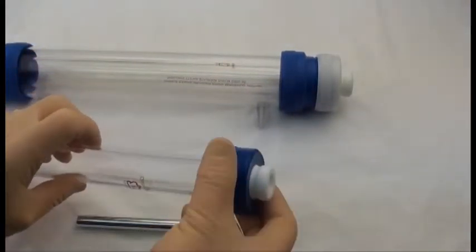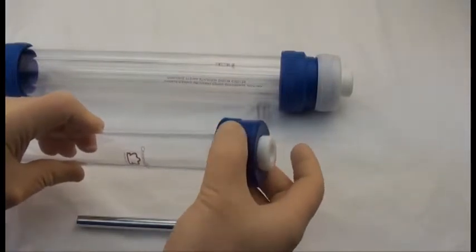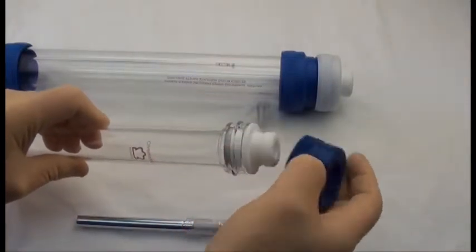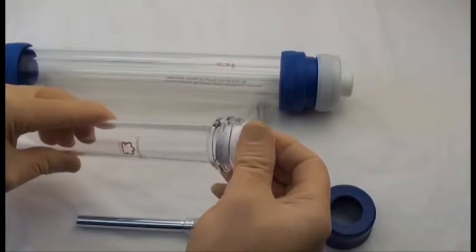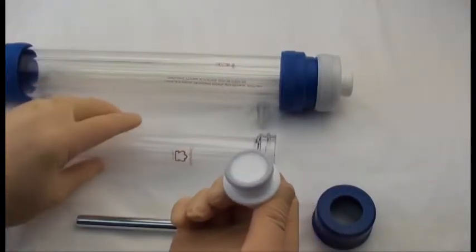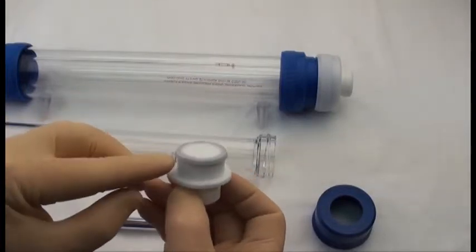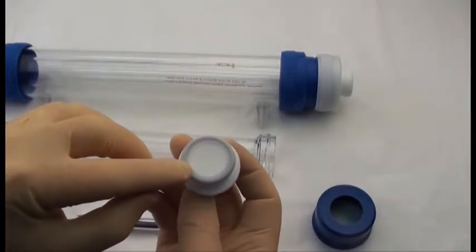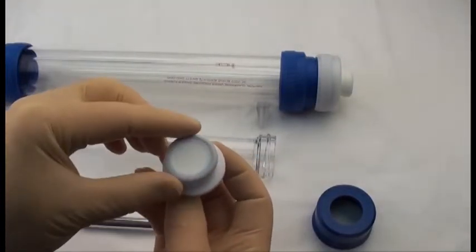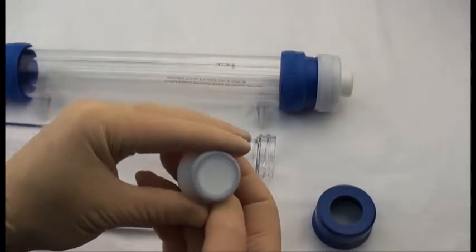But the first step is to remove the screw collar and then the end fitting. And you can see this is a PTFE end fitting. And the bed support is inside the end fitting.